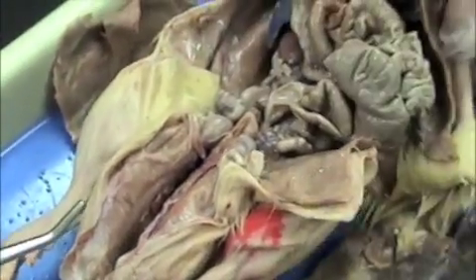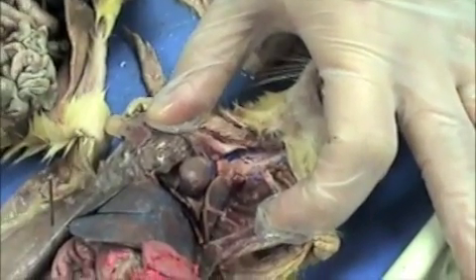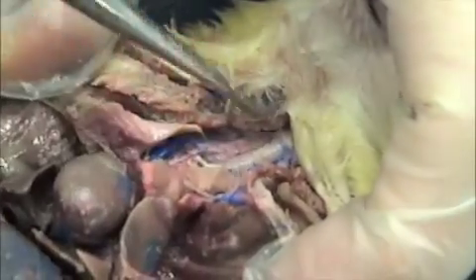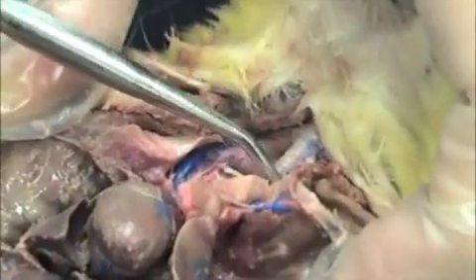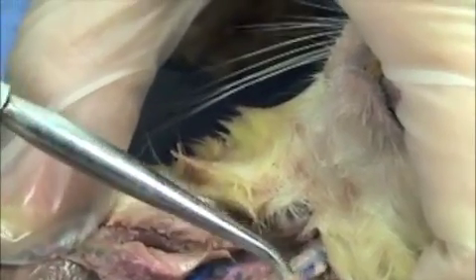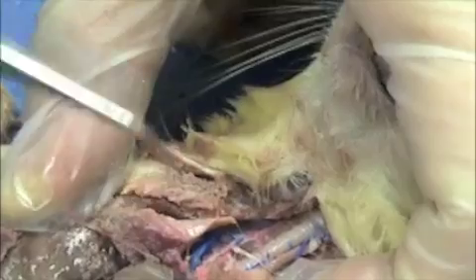Let's switch over to this other rat. This is another male rat — the coloring is just slightly different, but if you look at the overall structure you can pretty much tell what everything is. This is the trachea here; it's the white structure and it looks like little rings are on it. If you look posterior to the trachea, this little structure here is the esophagus — the light brown line. That's the esophagus there; it lies posterior to the trachea.